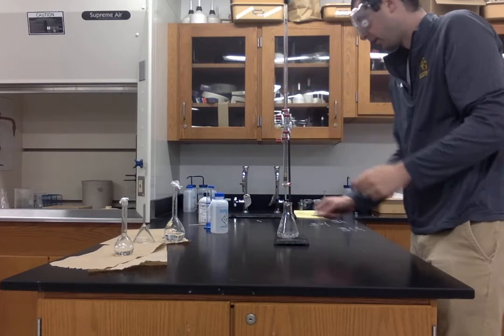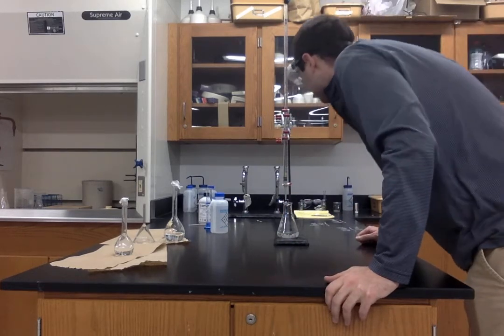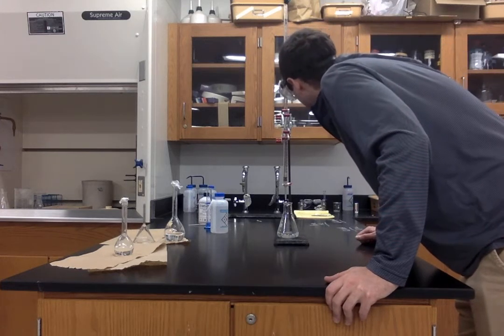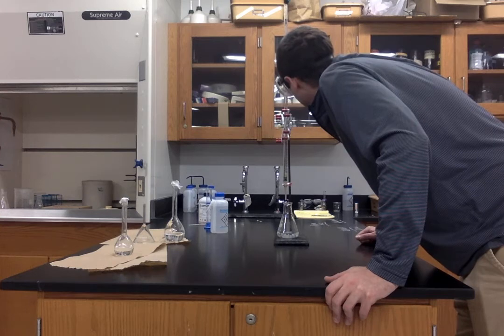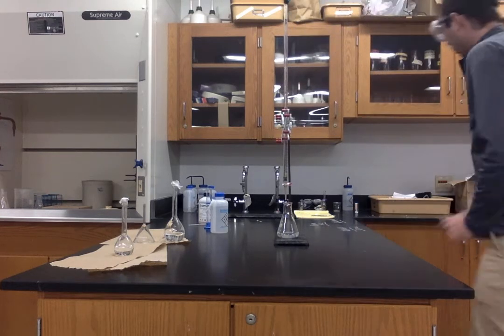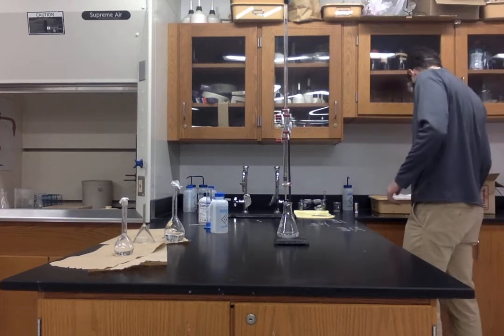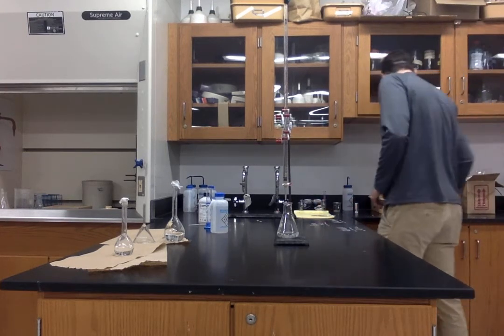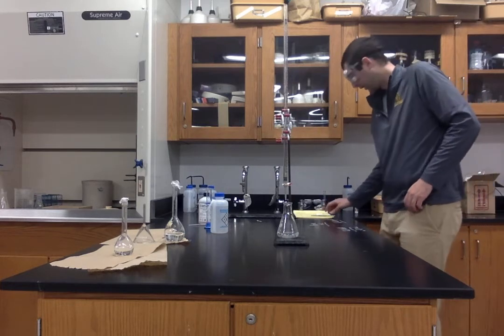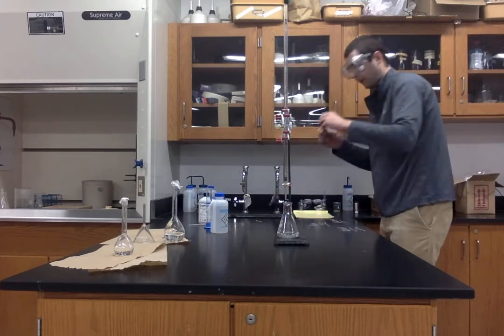Okay. Our volume at this point, let's get another pH reading. So our volume at this point is about 21.80. So we'll get another pH reading here.